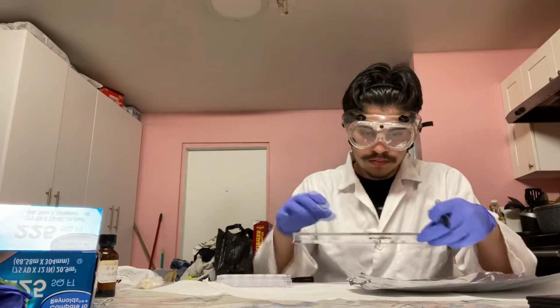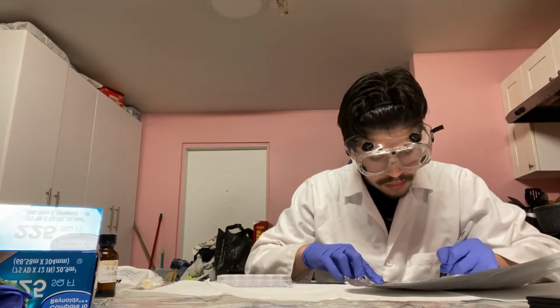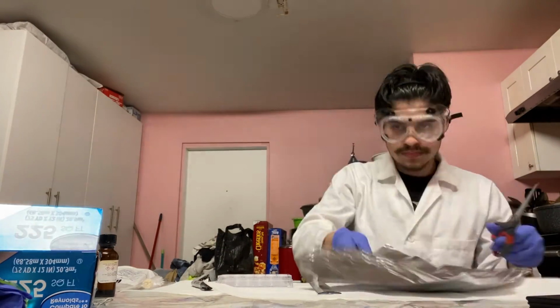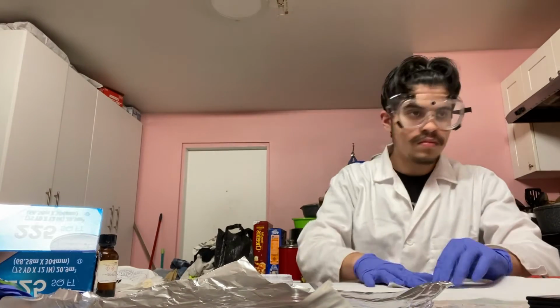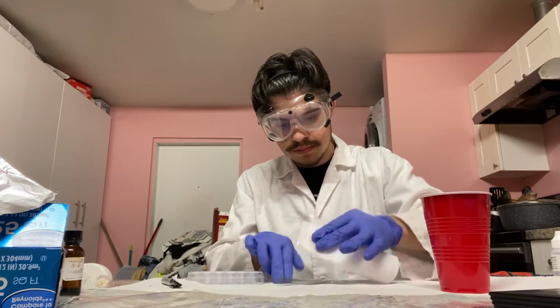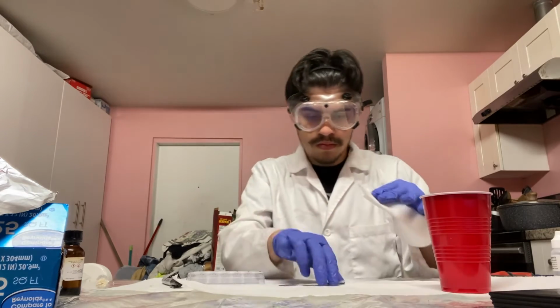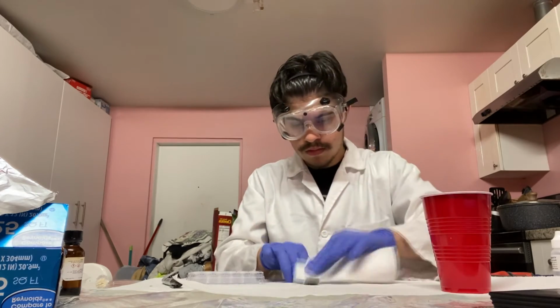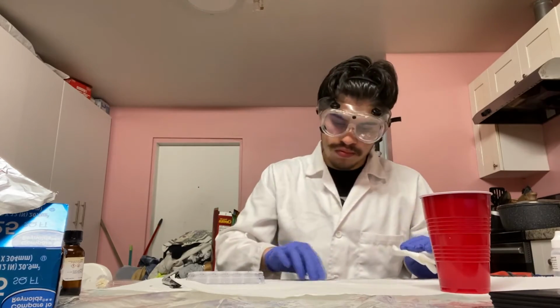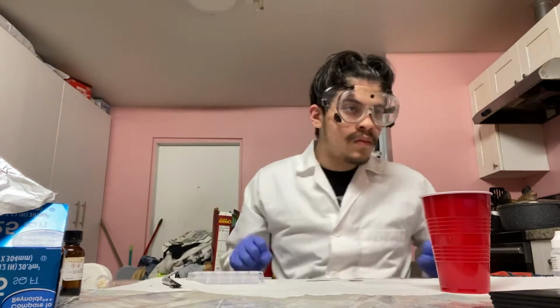Using a paper towel, gently blot away the remains on the foil. The goal is to make sure that the aluminum foil is dry. Once you made sure that the aluminum foil is dry on both sides, gently press against the aluminum foil to remove any wrinkles or creases. With the salt mixture that we created in the cup, saturate a paper towel and press it against the aluminum foil until it's damp.